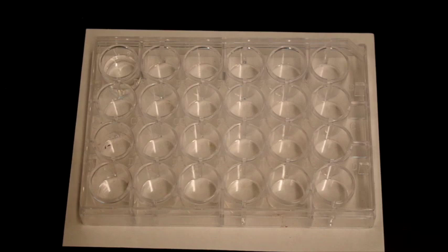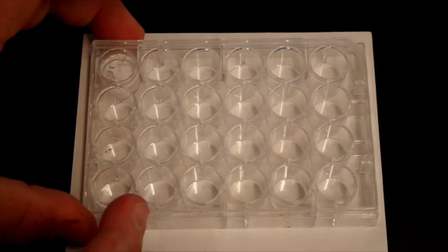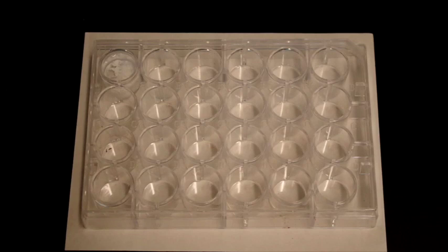And you can make deductions about what will happen based on the solubility of various ions. But if we take a dropperful of silver nitrate and add it to sodium chloride, you can see what happens. You see there is a cloudy white solid that has formed.